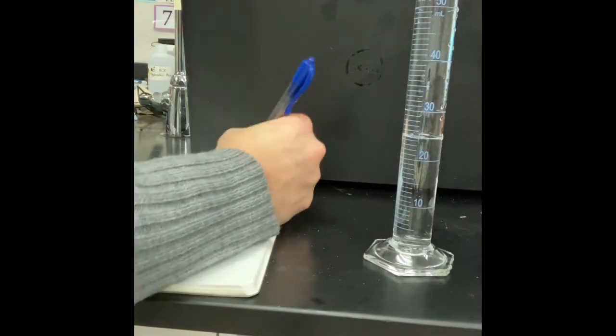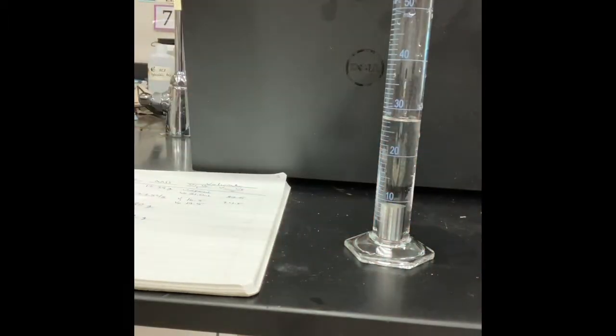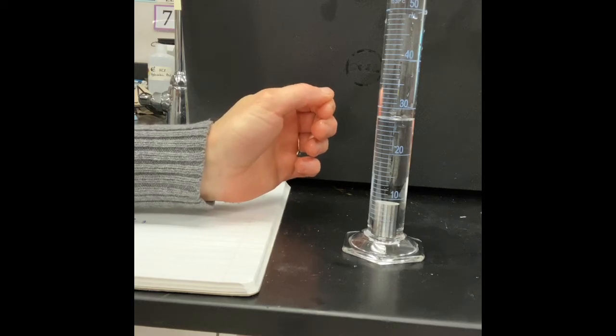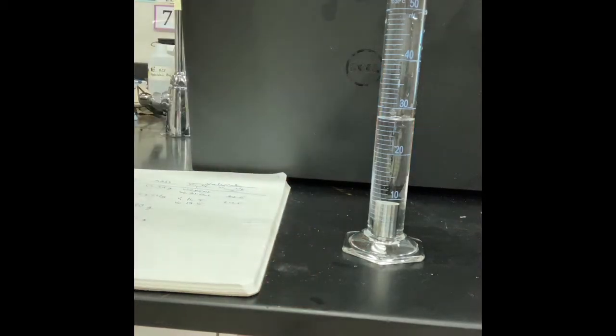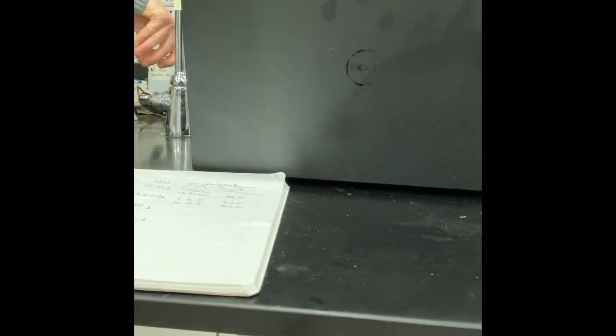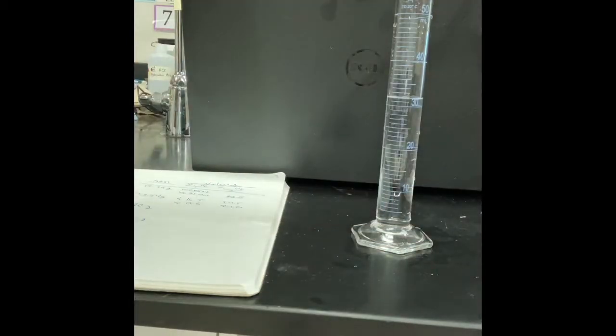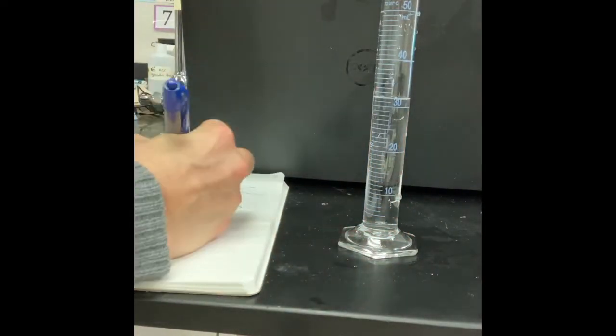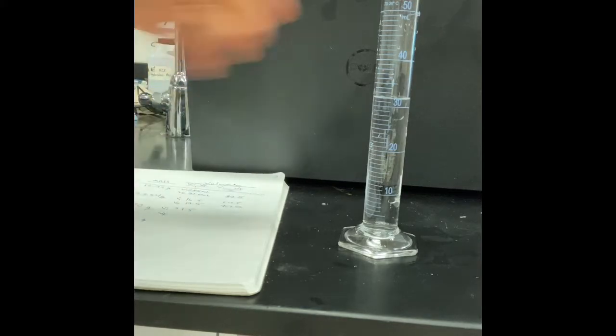So if you want more practice looking at values and measurements, go ahead and keep watching the entirety of the rest of this video. I am showing you in double speed at least all of the measurements that I took. They're all here. That is what makes the video so very long, even at double speed. So please skip ahead to the data table if you would like, but if you want a little more practice reading these volume measurements, go right ahead. And I will see you in a few minutes when we hit the data table.